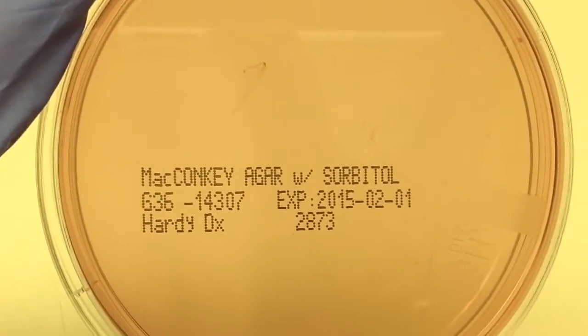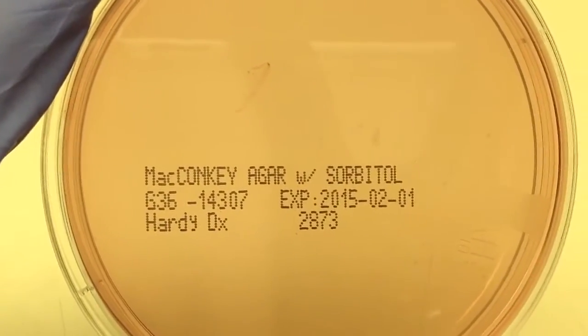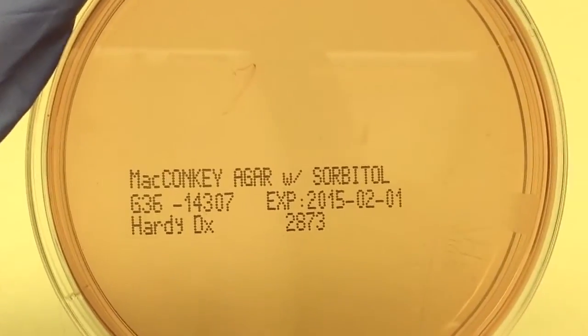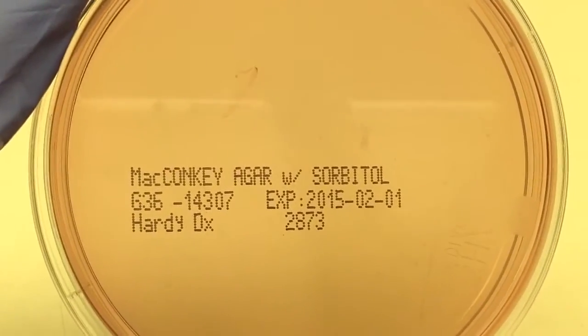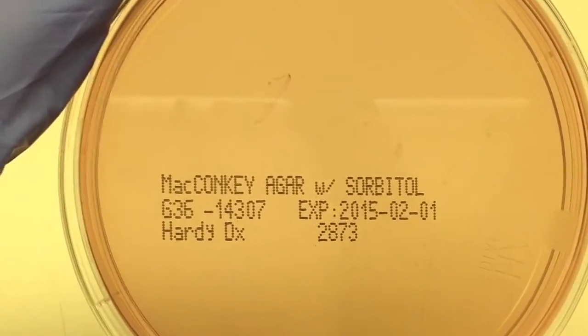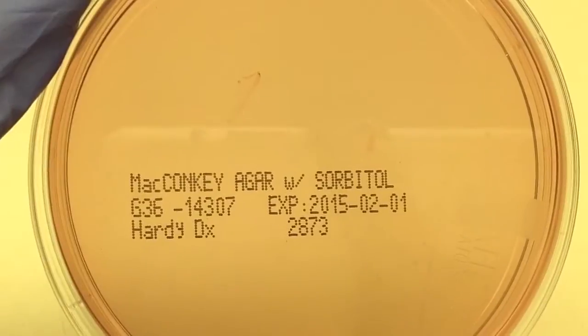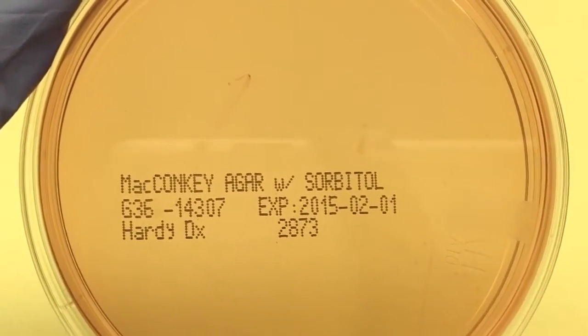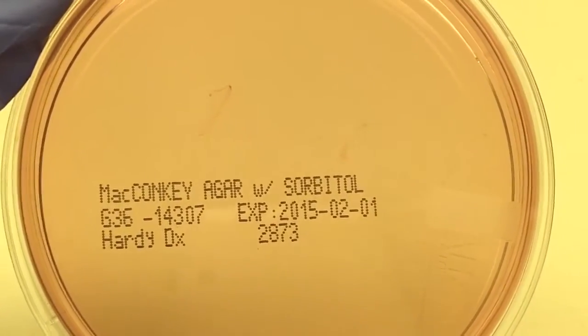This plate is MacConkey agar with sorbitol. This is used for the detection of E. coli O157:H7.